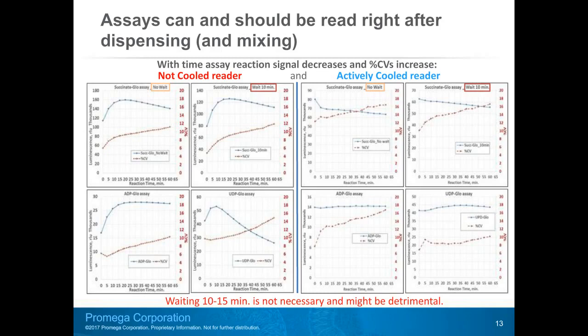The top 4 graphs in the top row illustrate the misconception that waiting 10 or 15 minutes will allow luminescent signal to stabilize. As you see here, there's no difference if you dispense and measure, or dispense, incubate 10 minutes, and then measure luminescent signal. For the not cooled instrument, 2 top left graphs, luminescent signal increases independently of whether you wait 10 minutes or not. And for the T-cool Spark, luminescent signal continuously decreases independent of 10 minutes incubation.